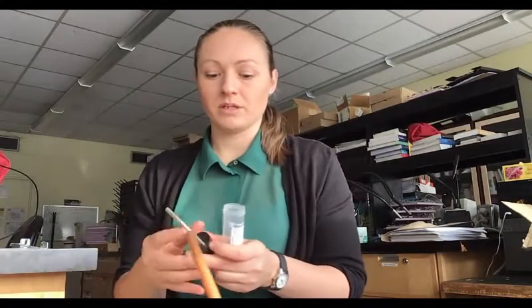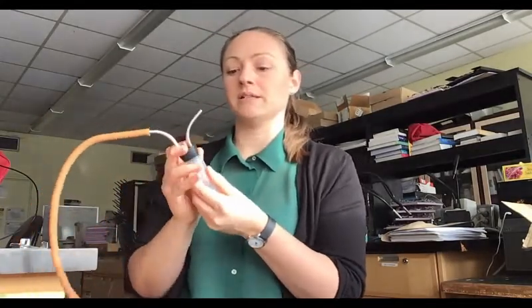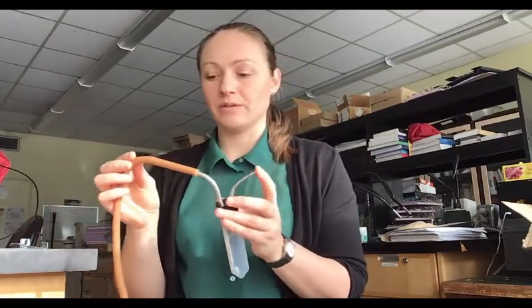You'll take the collection tube, unscrew the lid, and then put the rubber stopper into the collection tube just like that. It just sits on top. I'll explain a little bit about this before I show you how to use it.